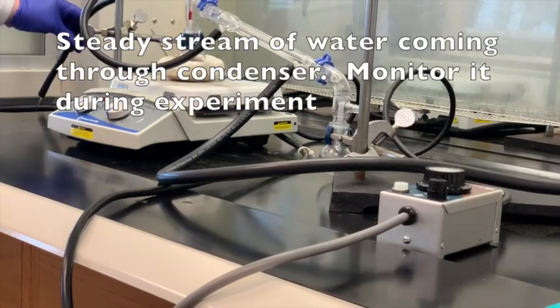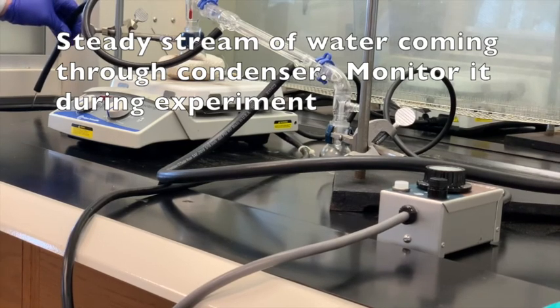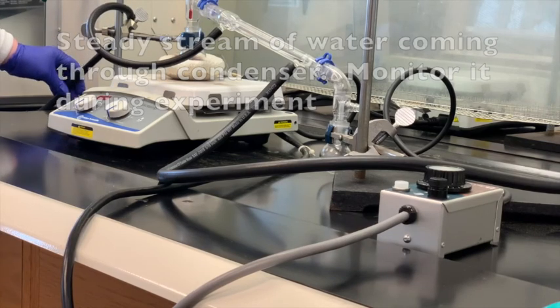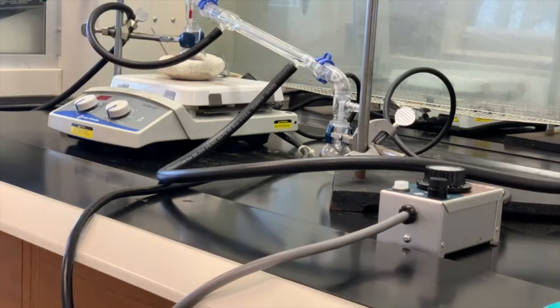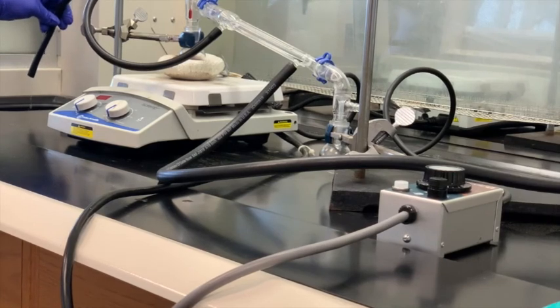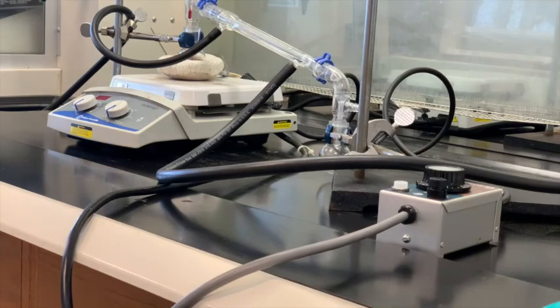Just to kind of give you an idea, you need a steady stream of water that's coming through. It can just be a trickle. It doesn't need to be a tremendous amount of water, and this is something that you want to periodically check throughout the distillation because sometimes, just because of changes in pressure, sometimes the water will stop moving. So periodically keep a check. You only need just a trickle of water, but it's important that you have some water coming through.